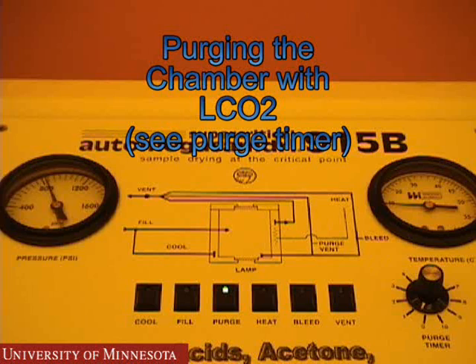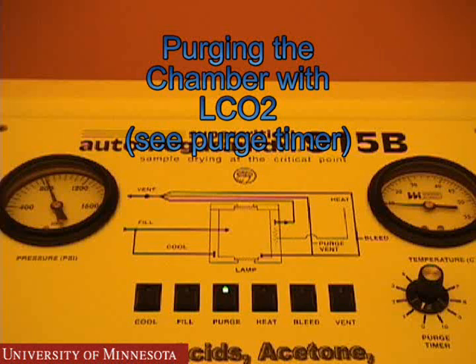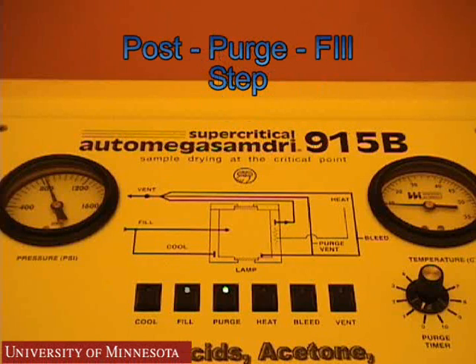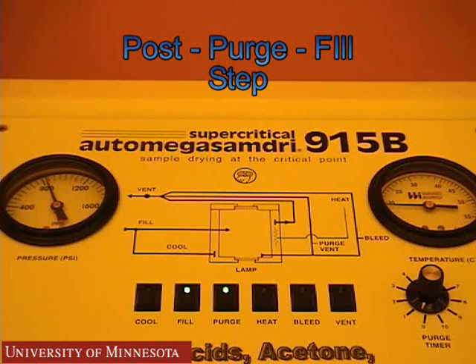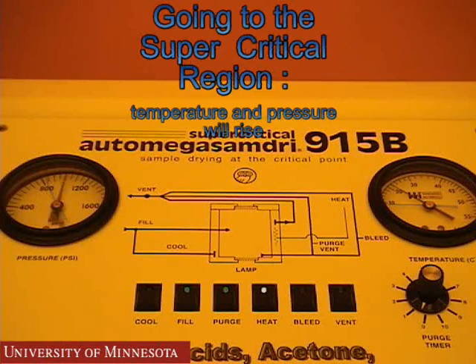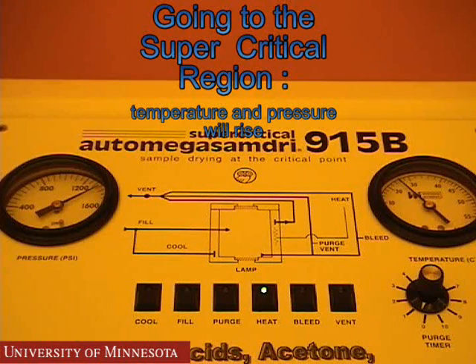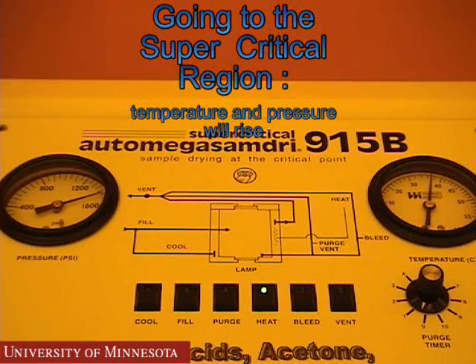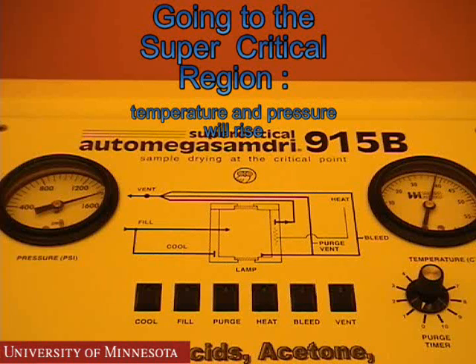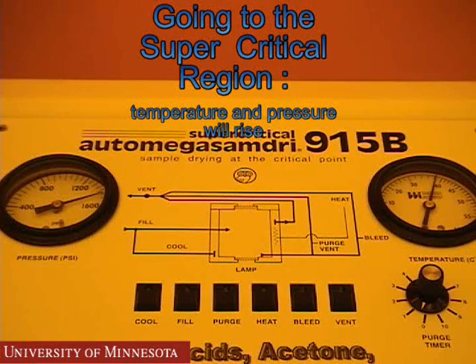During the purge step, the solvent in the chamber is purged to the condenser unit. The amount of time is determined by the purge timer. The post-purge fill step fills the chamber for an additional 4 minutes. During the heating step, temperature and pressure increase to the supercritical region, and it remains there for 4 minutes. If the chamber does not reach at least 1350 PSI, contact an NFC staff member and turn the machine off until assistance arrives.